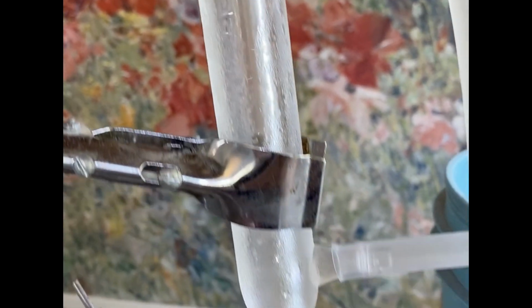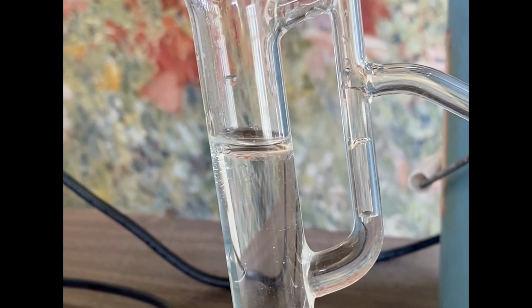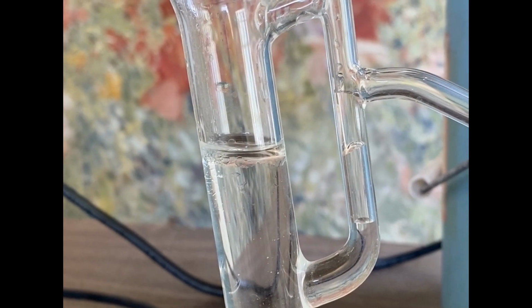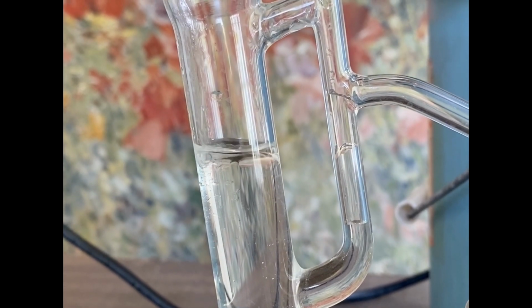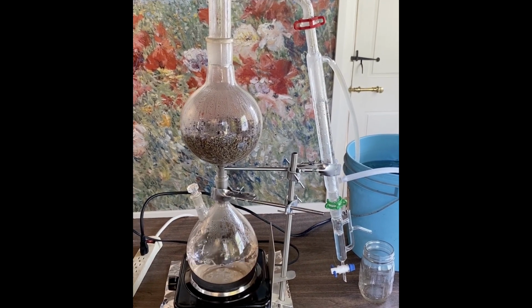So as we go down through that condenser, we come down to the separator, and you can actually see the oil already accumulating. See those droplets coming down? And now we see a division on top of the water. That little sliver is the oil. So far, so good. The magic has started.